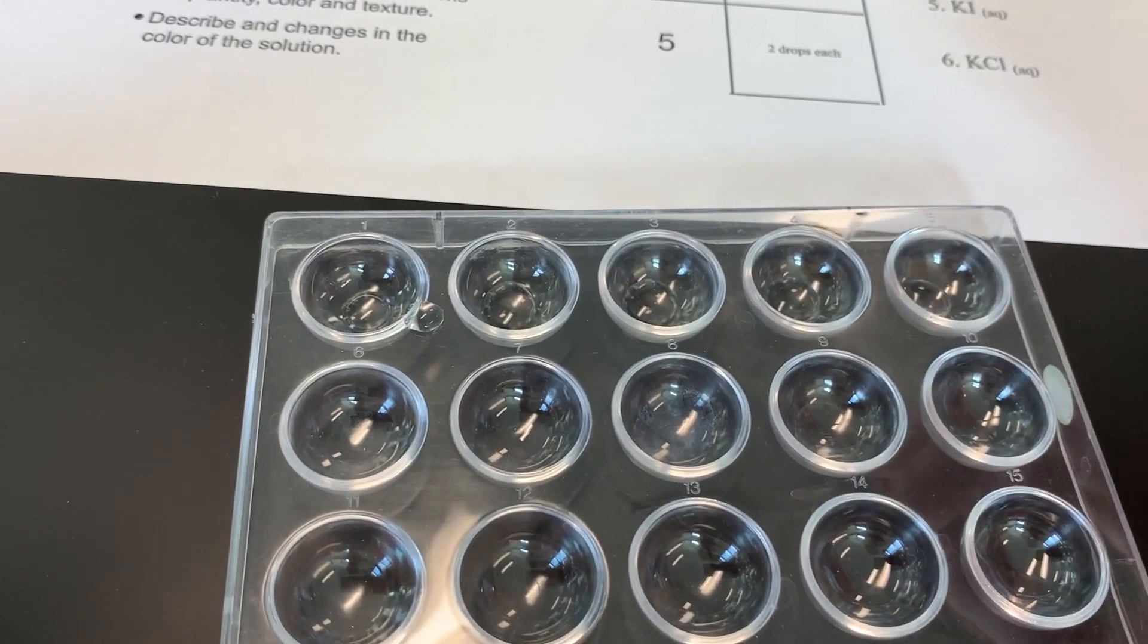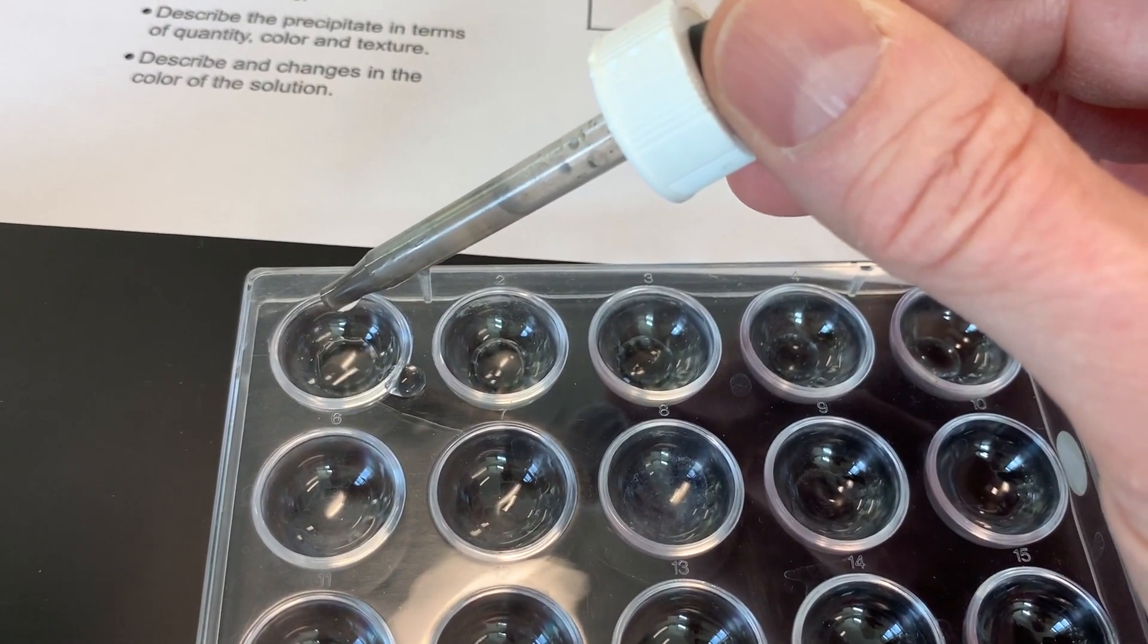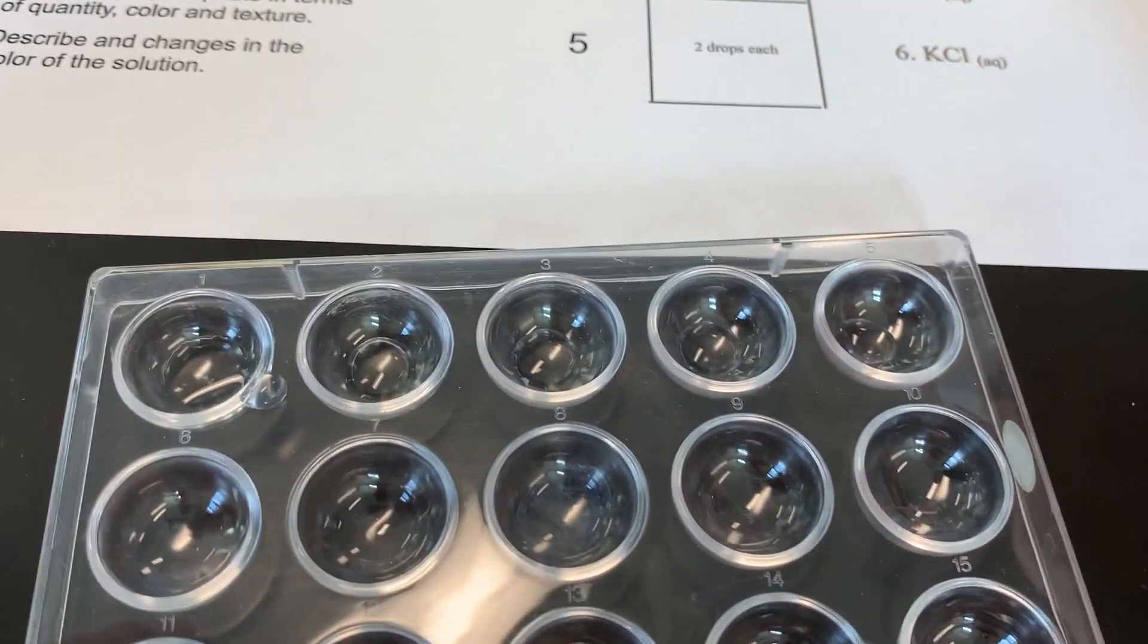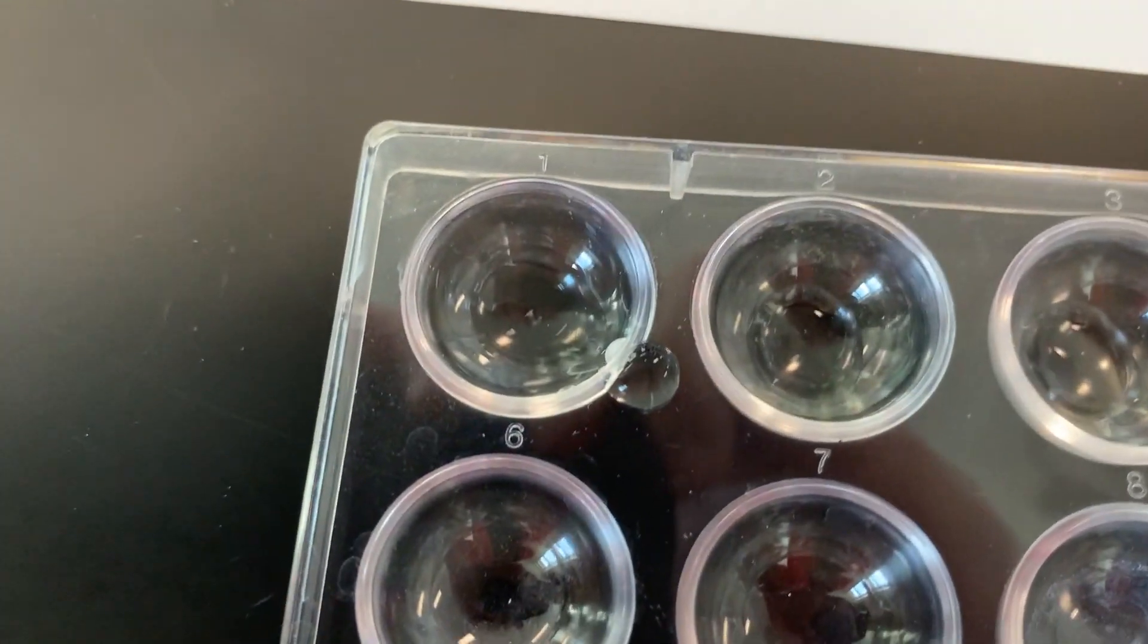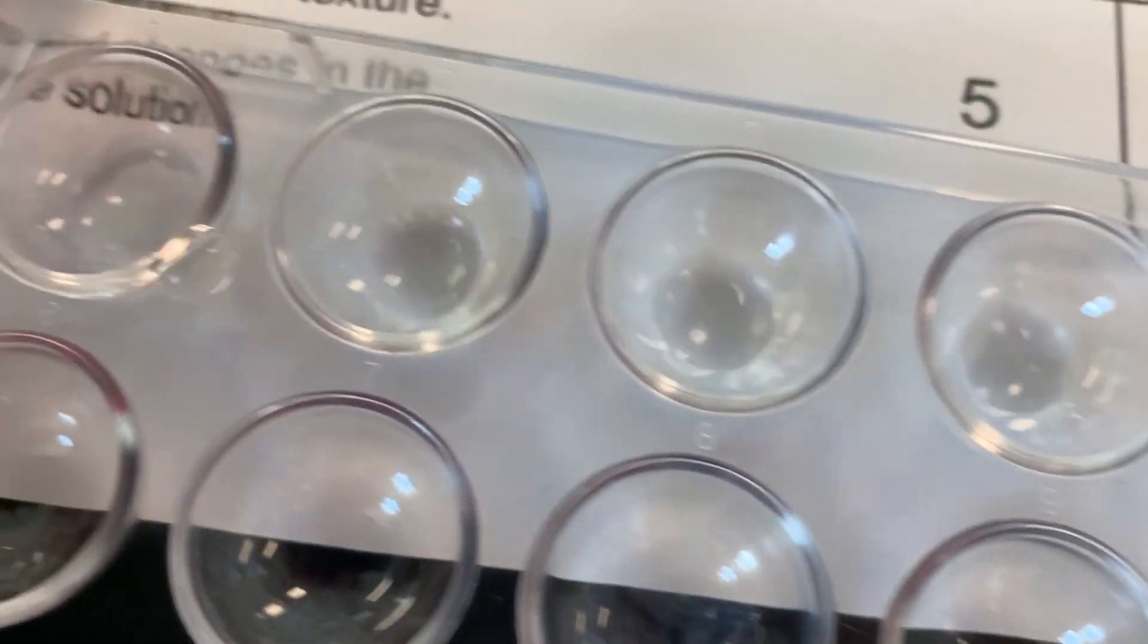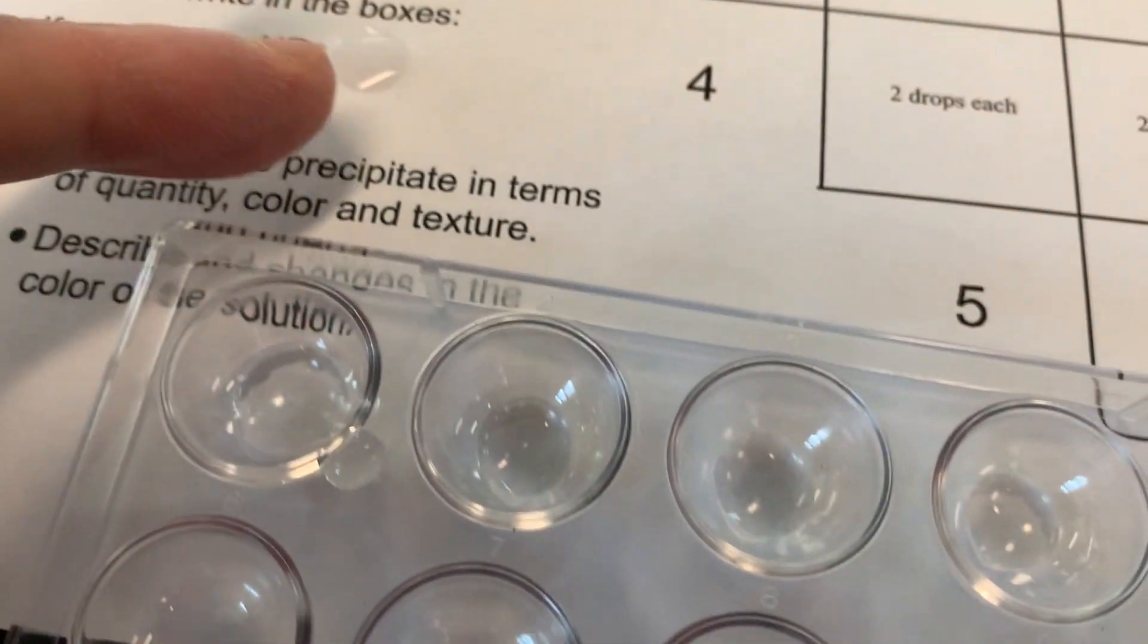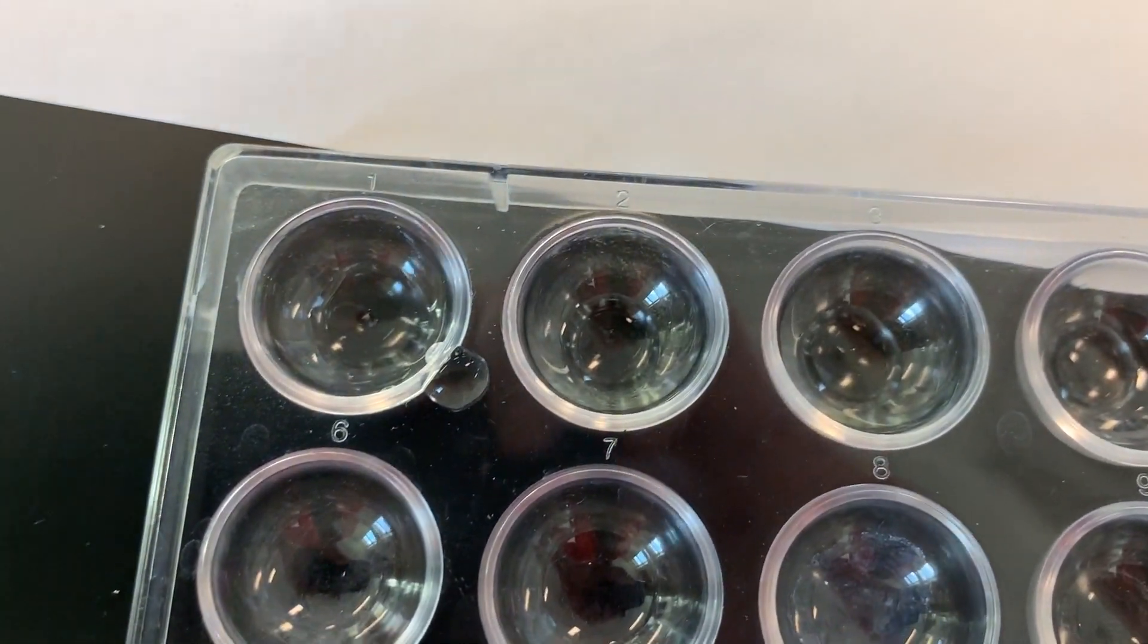Now we'll put two drops of silver nitrate in here with the lead nitrate. Let's see what happens. Looking at it, I really don't see anything happening. Sometimes it's good to look on a dark background, sometimes on the light, but nothing much happening here.